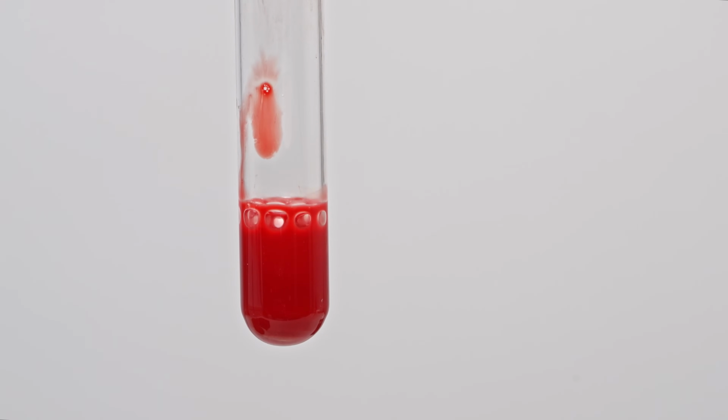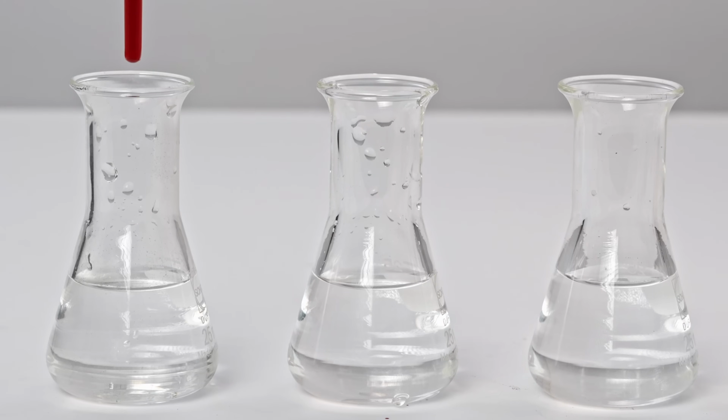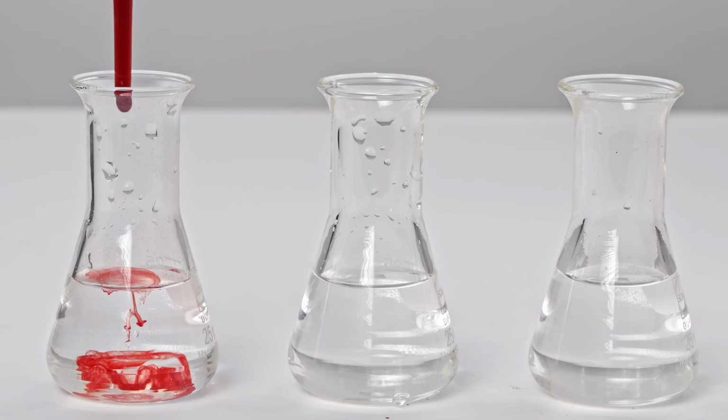So I decided to see what they mean when we talk about cherry red color, and I found this palette of colors. So here is a comparison. I dissolved 3 drops of blood in water, so that the shade was more distinguishable, and this is what happened.